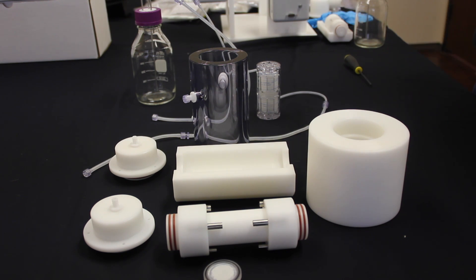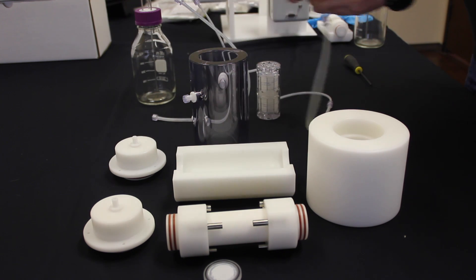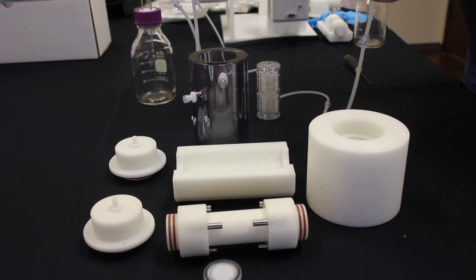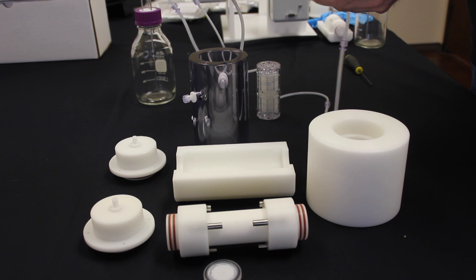First we use the bottle right here that I'll have Dr. Steve pick up. At the ends all you really need to do is get some aluminum foil and cover the port just there, so during autoclaving that is the part that's susceptible to contamination. You could sterilize that whole assembly in one shot.